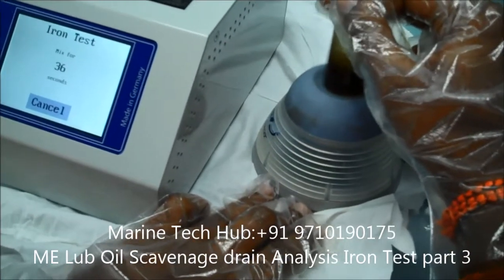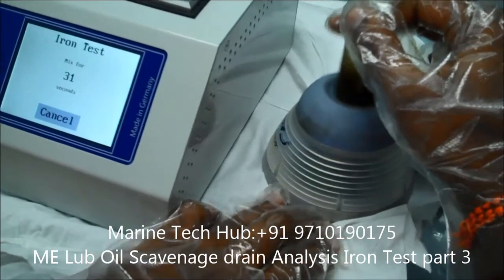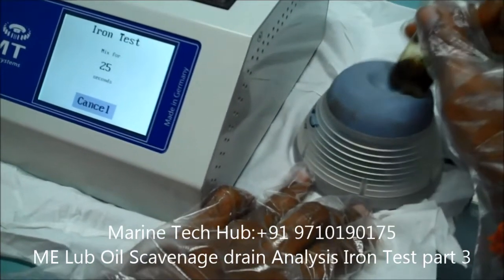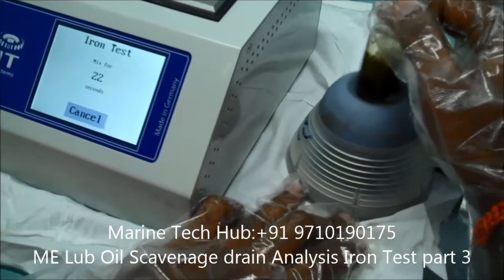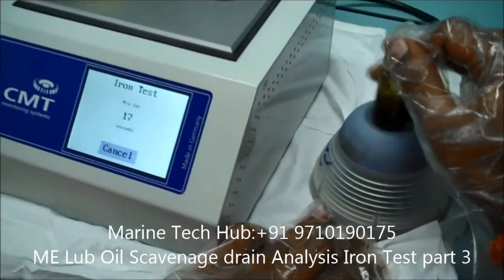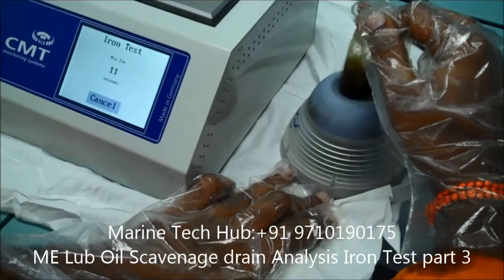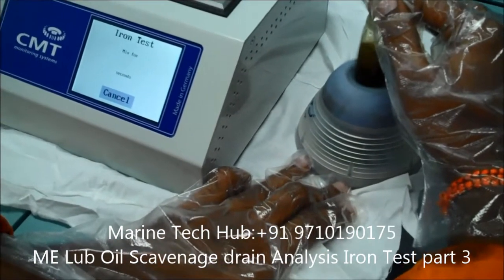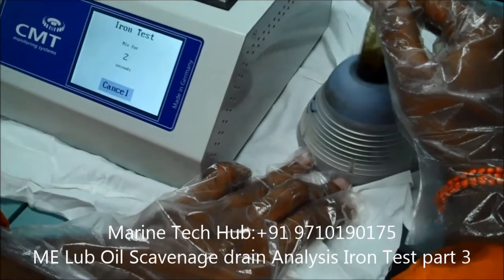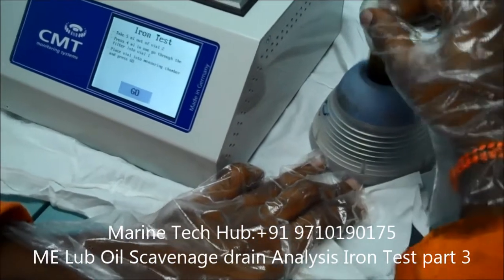Shaking the mixture is very important. You have to give more force so that it will mix properly, otherwise we will not get the proper readings. It is already 60 seconds. This is enough.